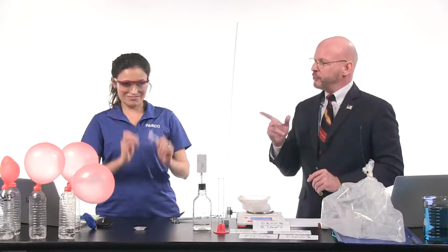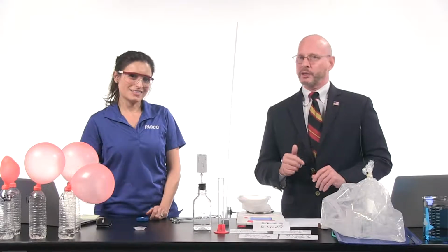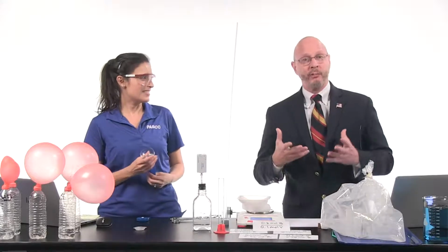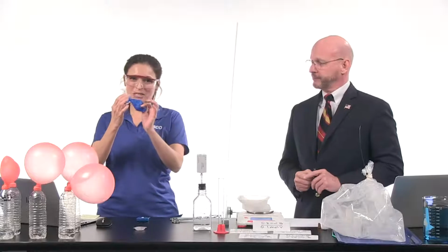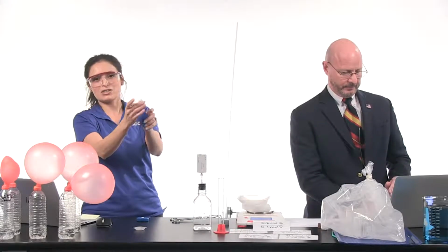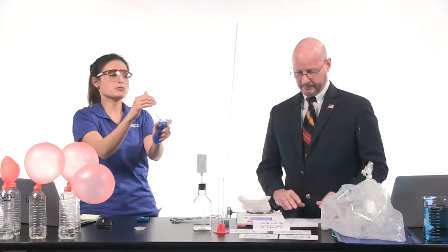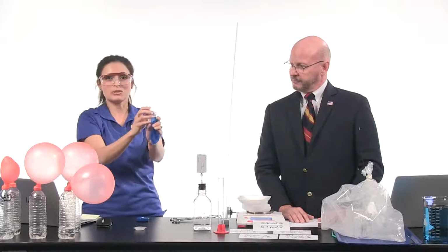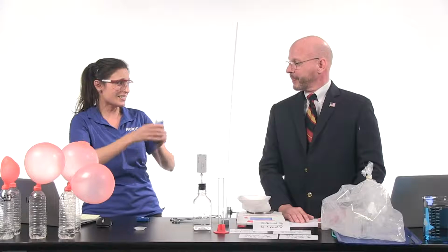So Barbara, you did something that makes this a little bit easier. Again, something you can do in the classroom, something you can do at home to figure out how much a mole of gas occupies. What did you do? Well, I got a punching balloon, and I made this little contraption out of the top of a soda bottle that had a kind of a wider mouth. And I used this to help me drop some 44.01 grams of dry ice into the balloon, and I sealed it.